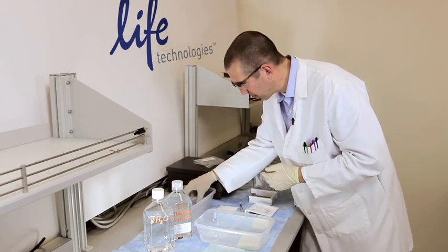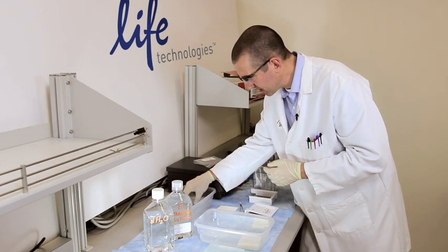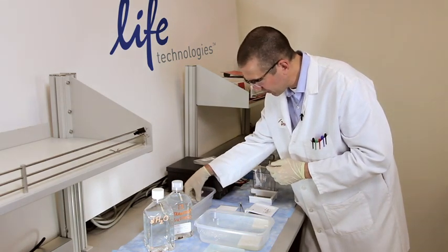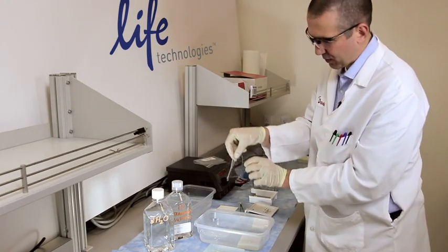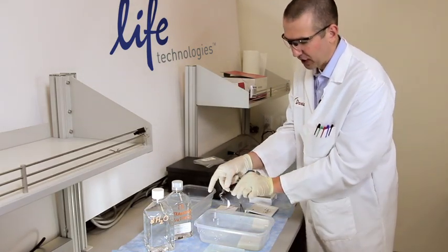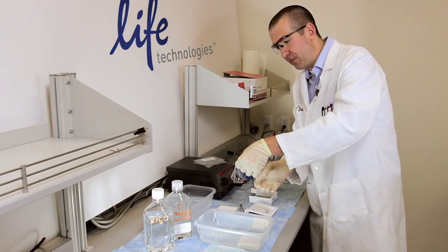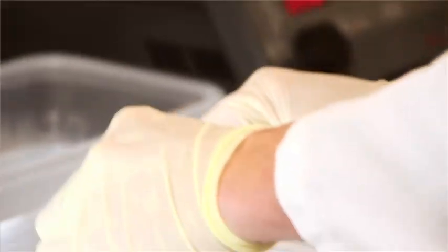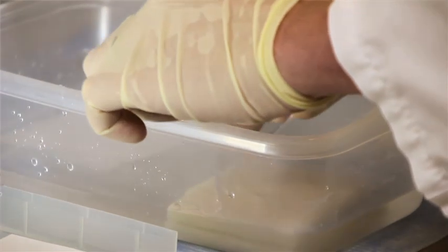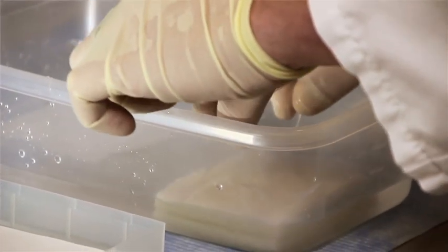Next, we're going to take our SDS-PAGE gel that I've got here. I've already taken it out of the cassette. It was a pre-cast gel, a NuPAGE gel, and I've cut off the bottom and the top.